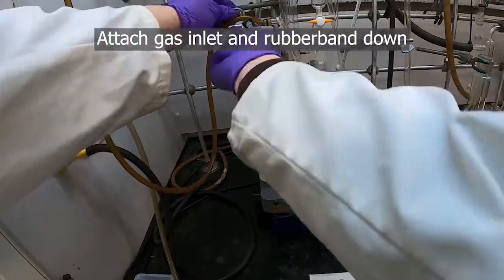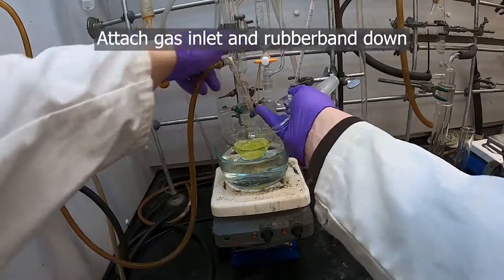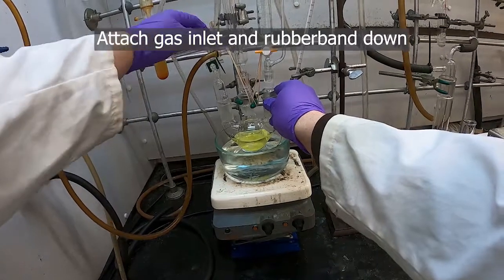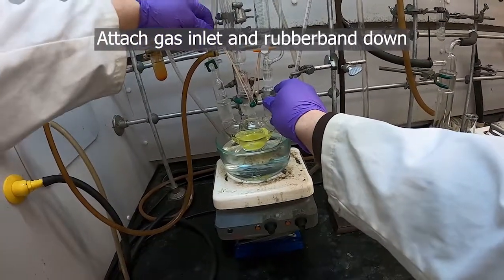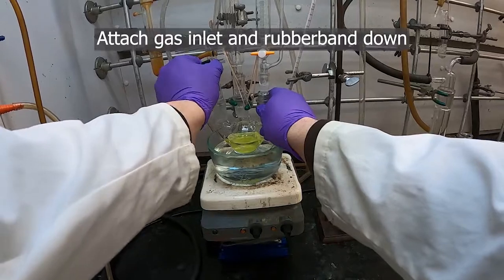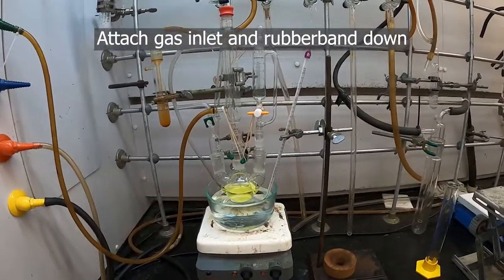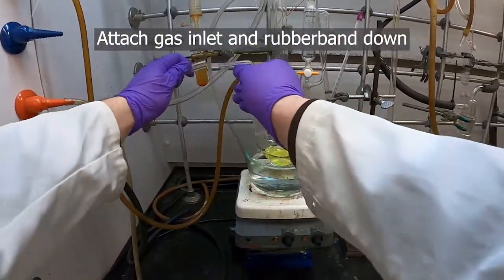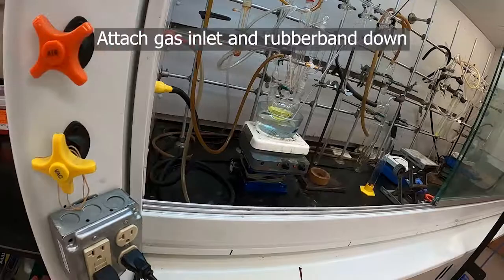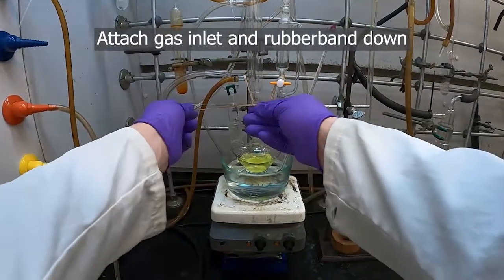And we can put our gas adapter in there. I pre-greased the gas adapter. I'll take our nitrogen line here, attach that, and then we'll secure this guy with rubber bands.